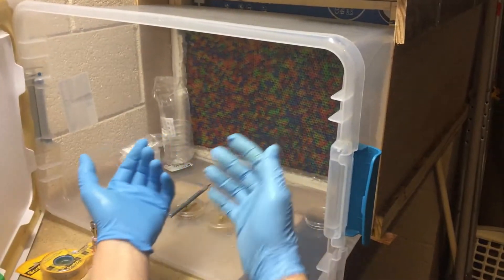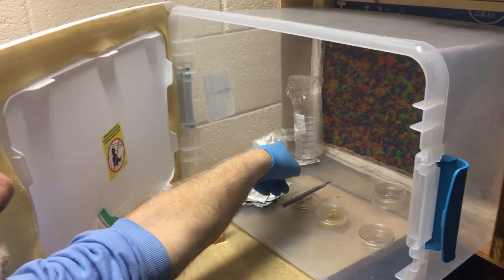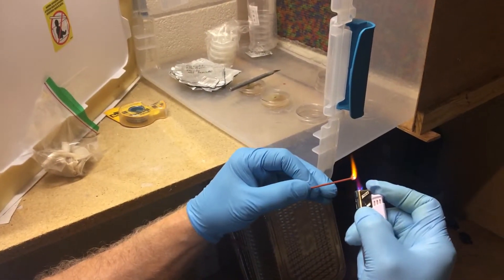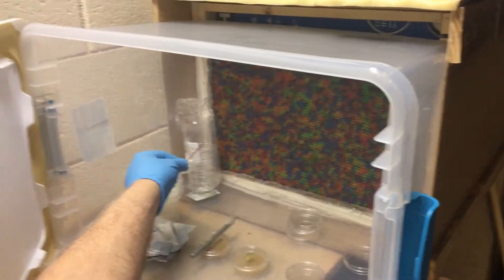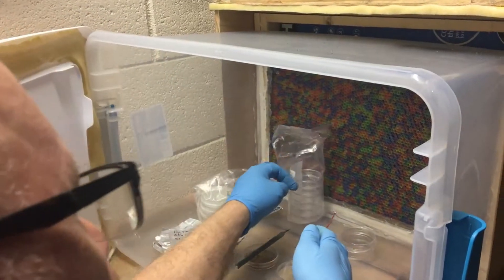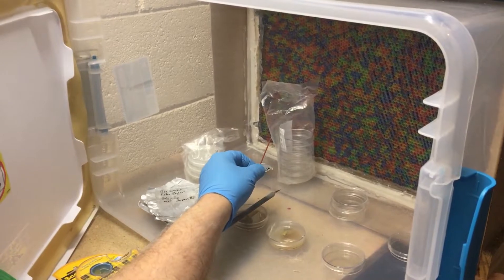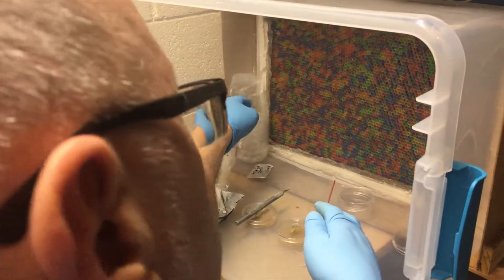Anything that's unobstructed should have direct flow of air coming through here, but if I put my hand over here there's going to be turbulence going behind it. A way of demonstrating this would be using some form of smoke. You can see that the smoke comes directly out, but if I put anything over here in front of this, I start to get turbulence — the air starts to move around in unpredictable ways. You want it to come straight out.